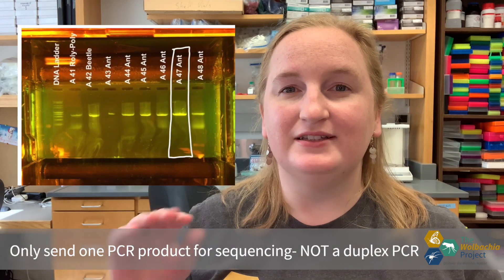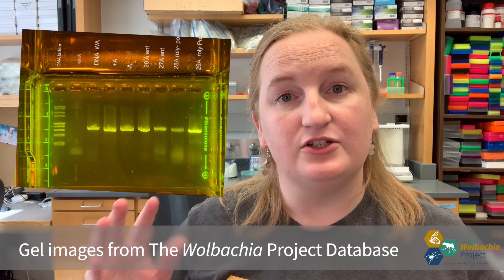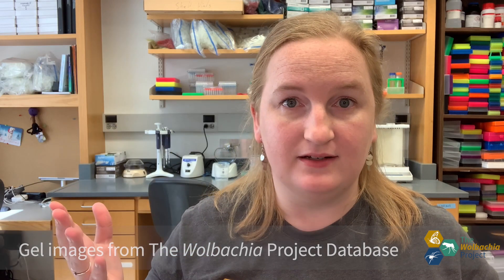If you got a single, nice, clear band on your gel, you're able to send your PCR products off for sequencing. How does sequencing work? We use Sanger sequencing to determine the order, or sequence, of the nucleotides that make up DNA. Sanger sequencing actually works similarly to PCR, except there are some special nucleotides with some markers on them that are added to the PCR mix.